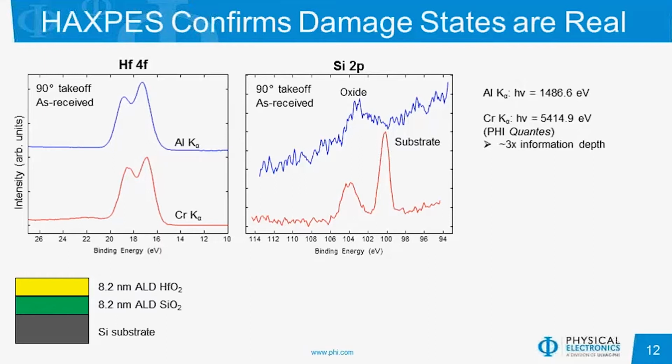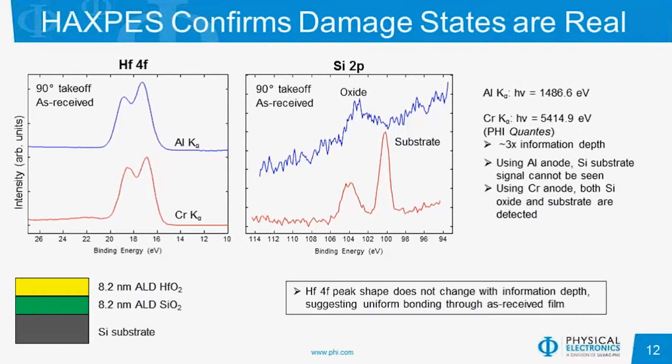However, we notice in the hafnium 4F there is really no change between the two sources. If there was some type of damage at the surface in the hafnium, we may expect there to be some type of shoulder on that, which we do not observe. And so we can assume that the damage that we're observing during profiling is representative of the profile itself and not something inherent to the stack.